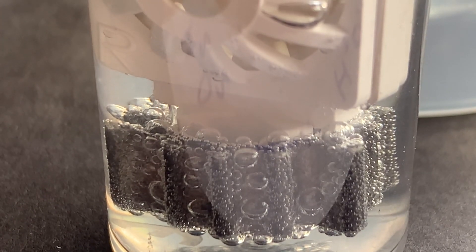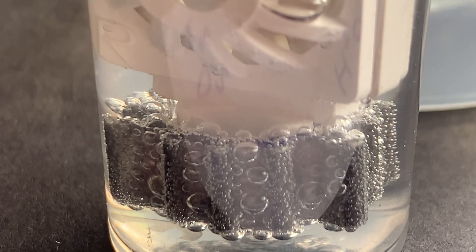Oh, there it goes. There goes one of them. Oh, my eyes feel cleaner just watching it. How about yours?